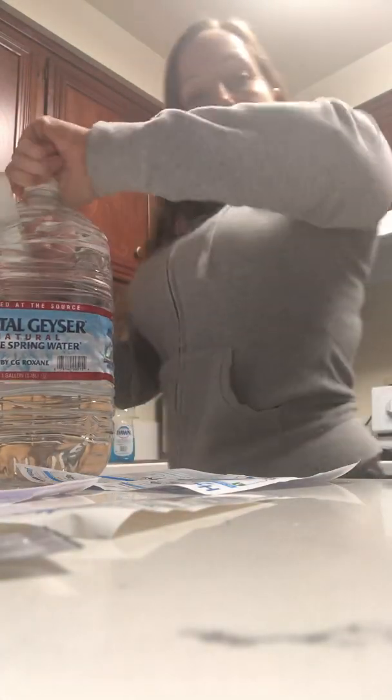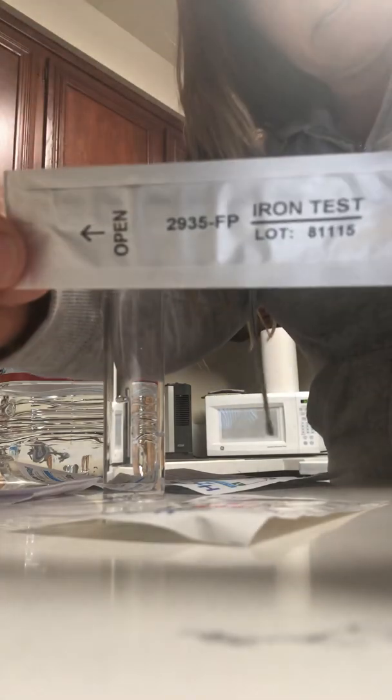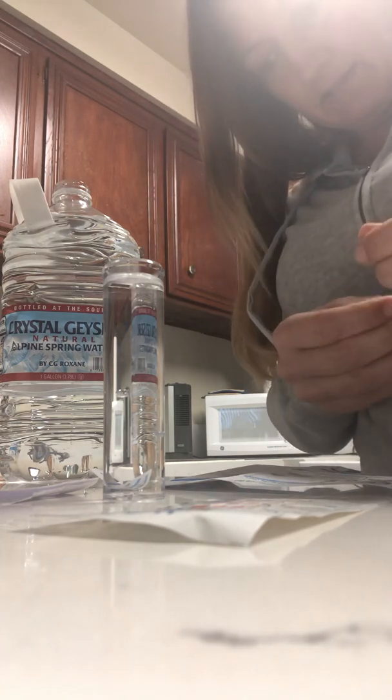Okay, let's do one more. The last one is going to be the iron test. If anybody knows what the hardness is or should be, I'd love to hear your comments. So now we're going to do the iron test. The iron test instructions say dip the strip for two seconds and then wait 60 seconds.